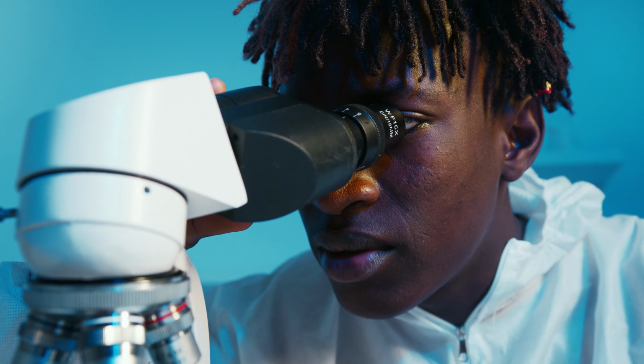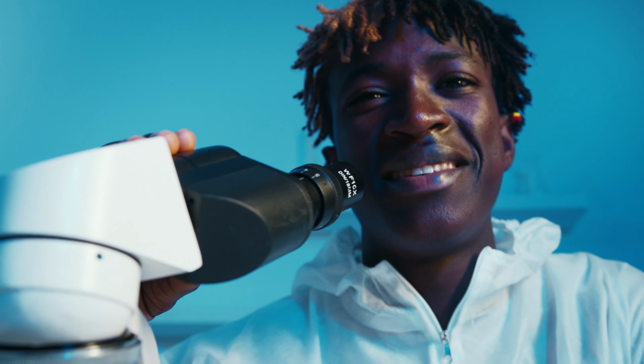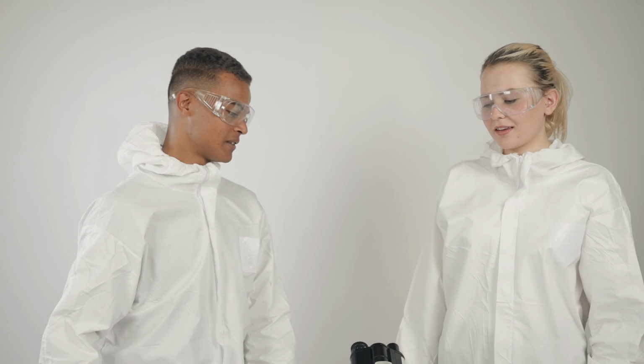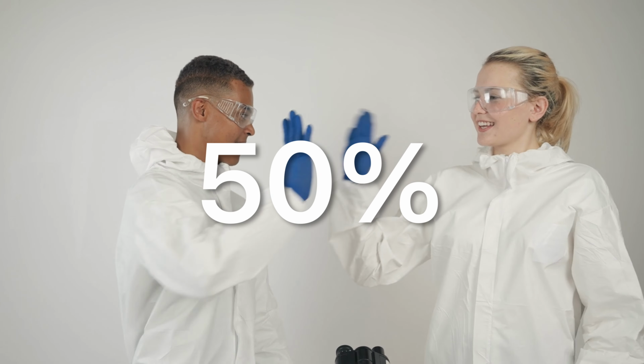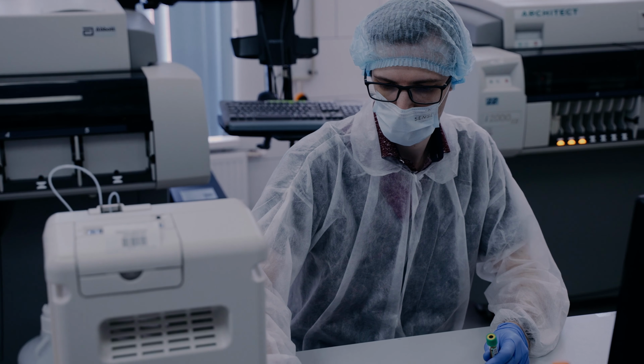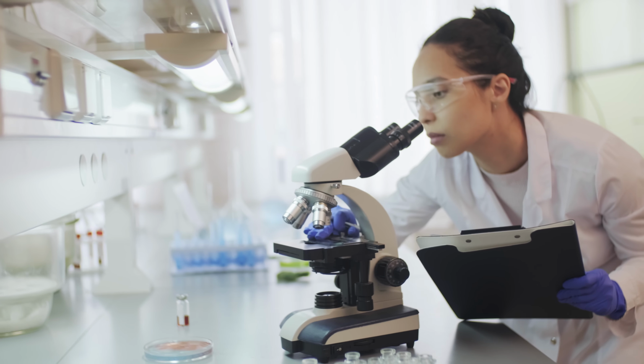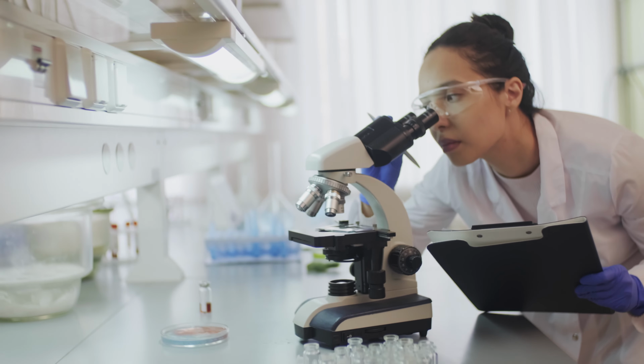What took hours to days can now take minutes. Analysis that was bottlenecked can now happen almost instantaneously. We're cutting analysis time by over 50%, allowing labs to scale experiments and accelerate their discoveries. Neurolight frees researchers to focus on what matters, understanding the biological clocks that govern human health.